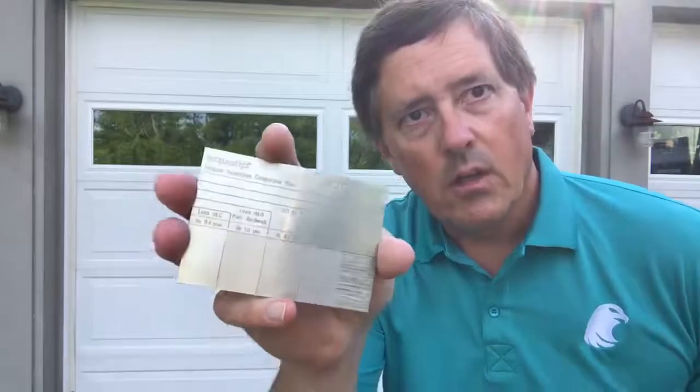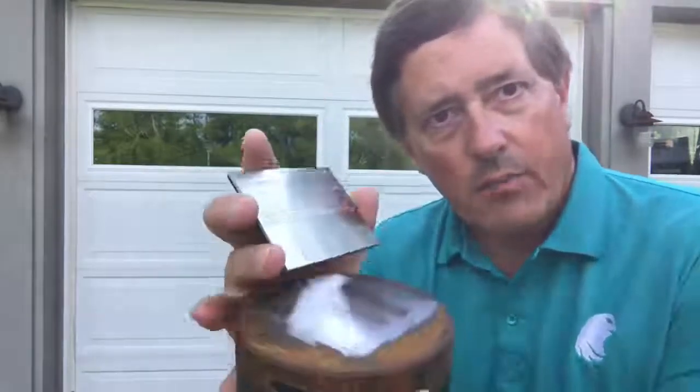So this gives you a nice tactile and visual confirmation. And it's small enough, it fits in the pocket, and you can put it right on the surface of what you're going to test. So now you can just run your finger and say, okay, yep, my surface is better than the minimum requirement on this comparator plate. I have a good surface preparation. Now I know I can have confidence I'm going to get accurate hardness readings.